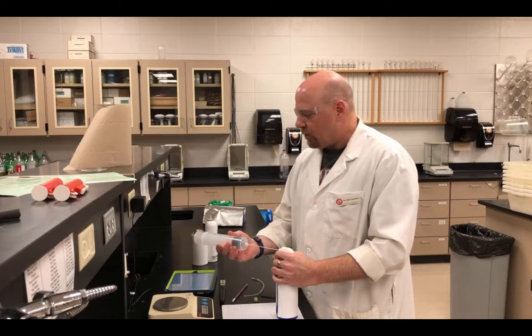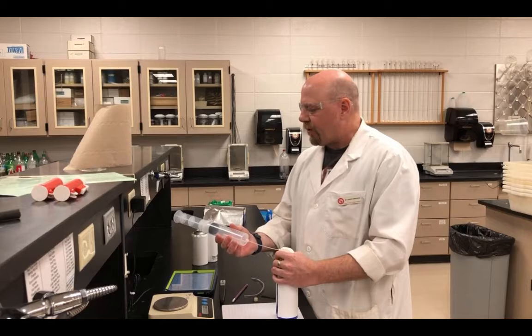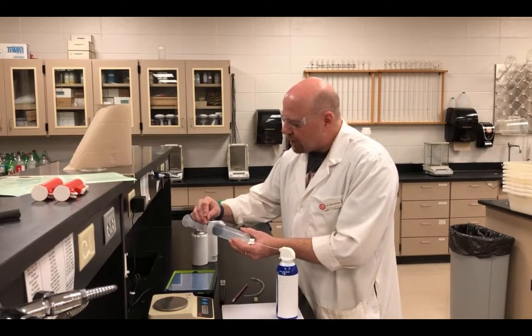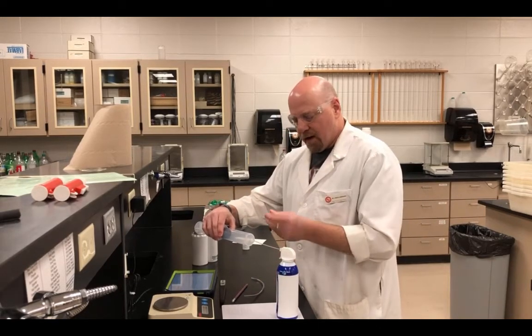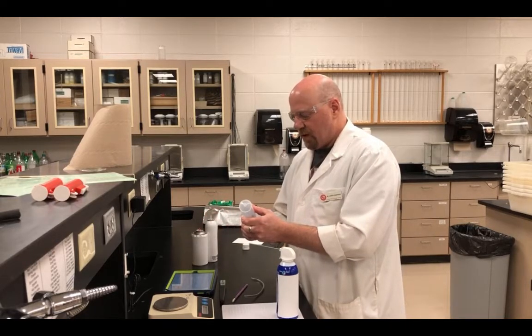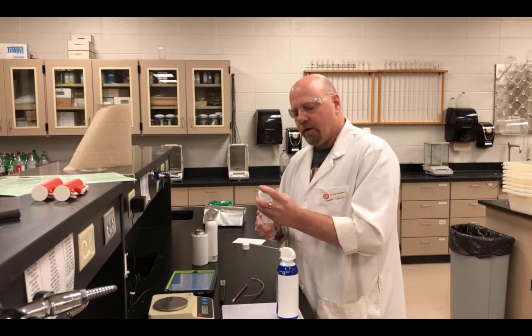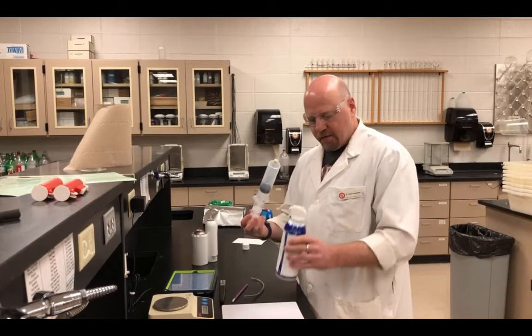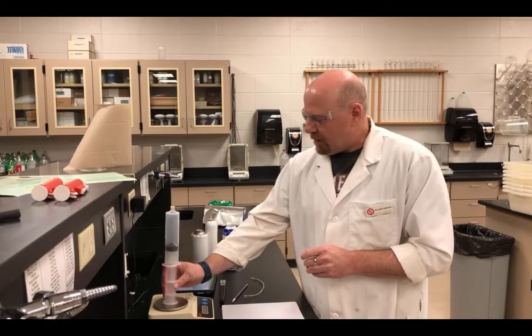And what I'm going to do is fill it so that it's past the volume that we're going to have. I'm going to insert my nail here. Get my cap ready. Disconnect this, and I'm going to close this up until we are at the volume that we had set earlier. Cap it, and now we should have only the gas that this produces inside of the syringe. We're going to weigh it.